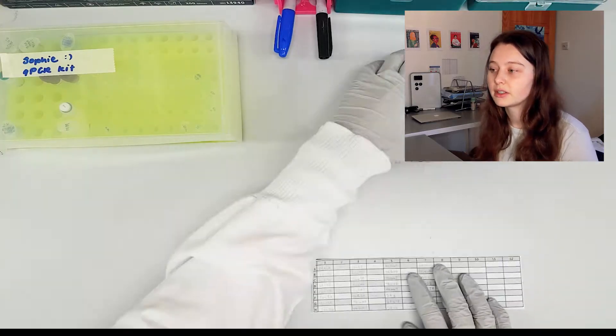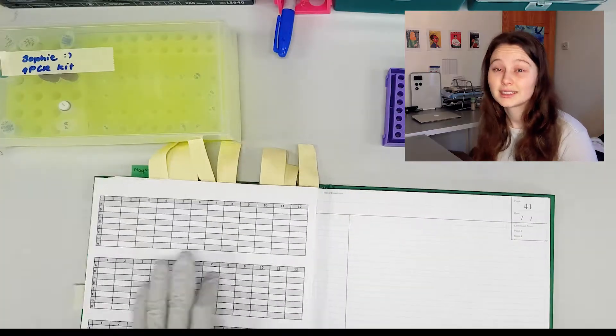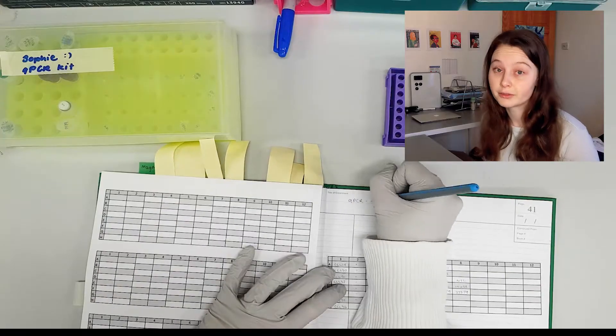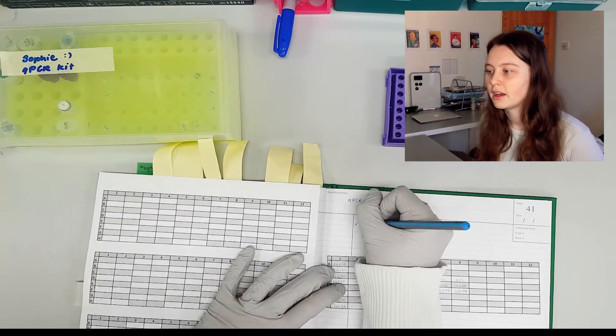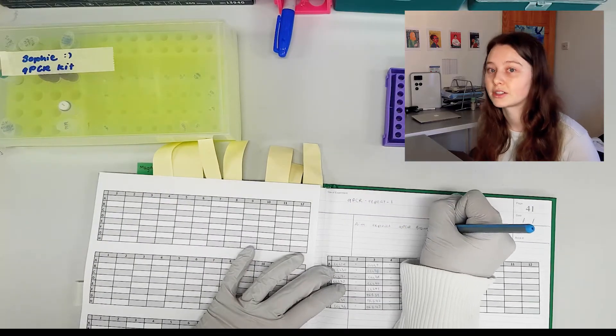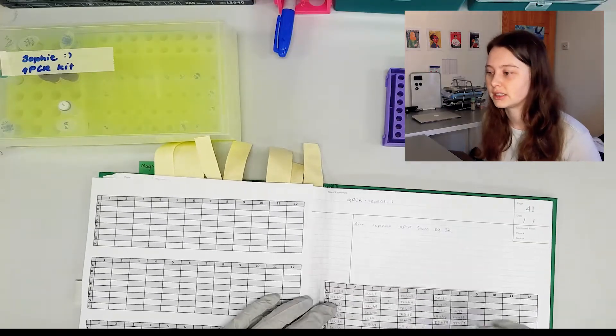So now that I know how many samples I want I'm going to go to my lab book. I like to keep my lab book tidy, it's not for my scrap calculations, for me it is what I actually did. Not what I intended to do but what I actually did.